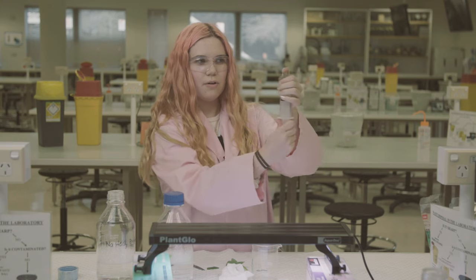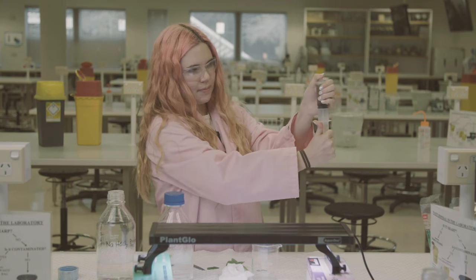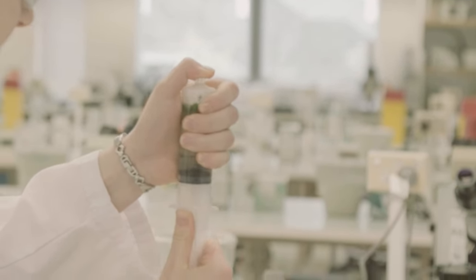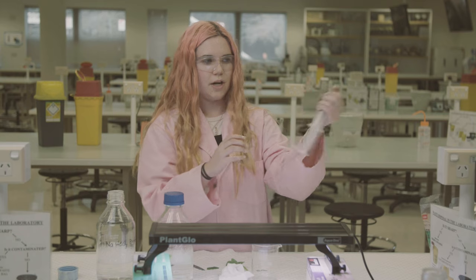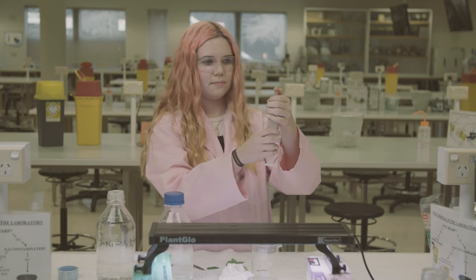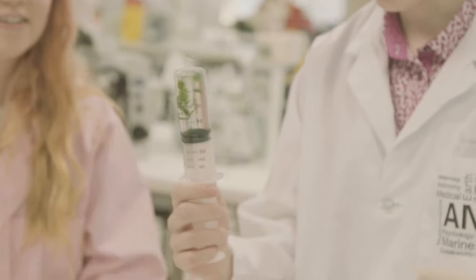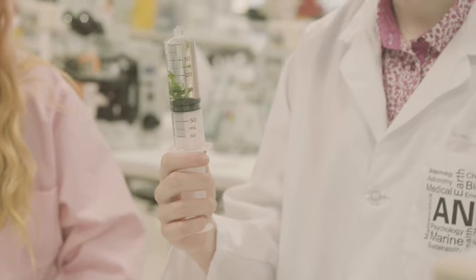To do that, with all the air removed, we just pull really hard a few times and give it a good shake. We should then see our leaves sink. Once they've sunk, we know that the air inside them has been replaced with our solution, and we're good to go.